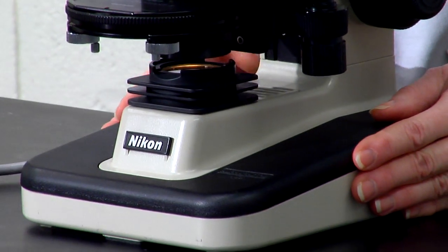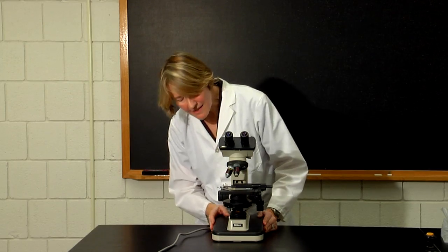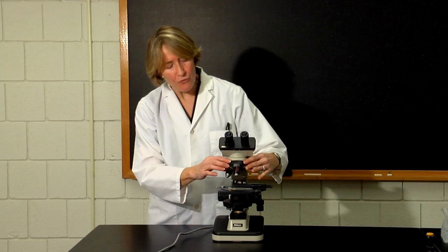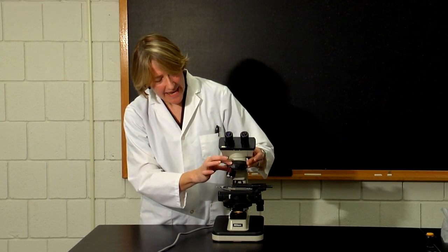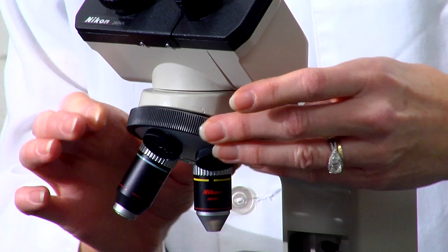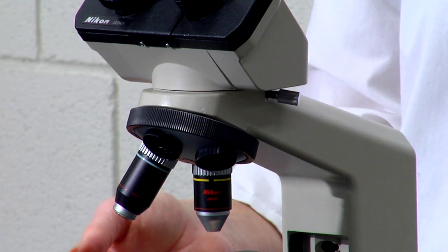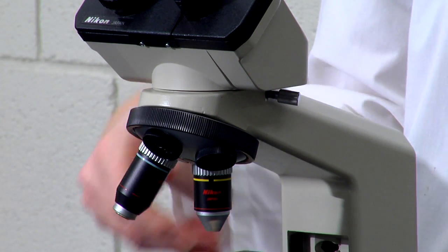Turn on the light source and adjust the intensity of the light as needed. You want to rotate the nose piece so that the 10x objective lens is over the slide. You always want to start with the lowest power lens, which has the largest field of view.